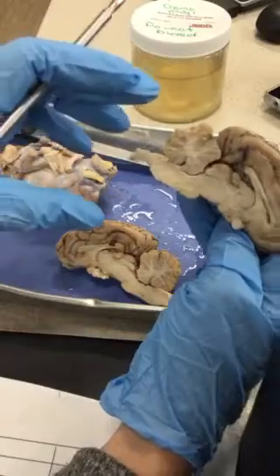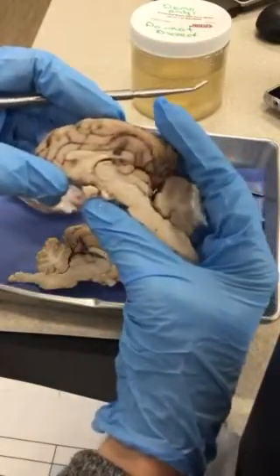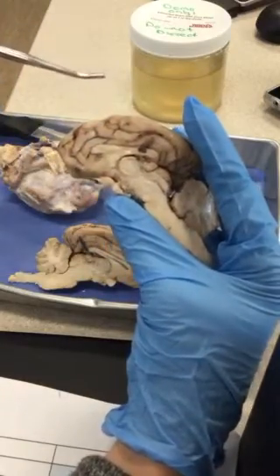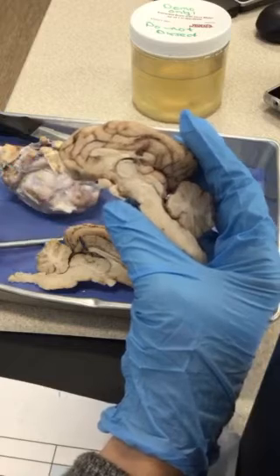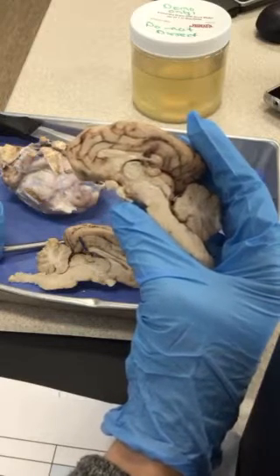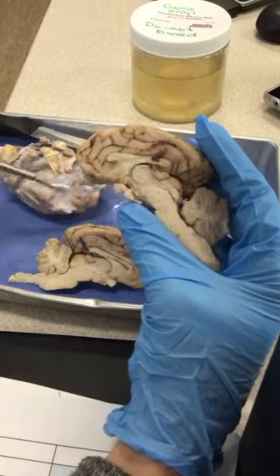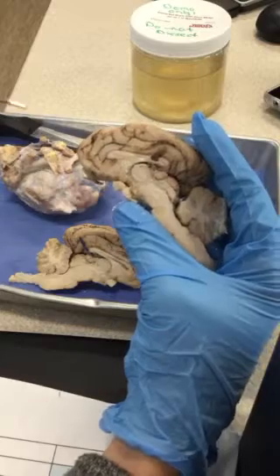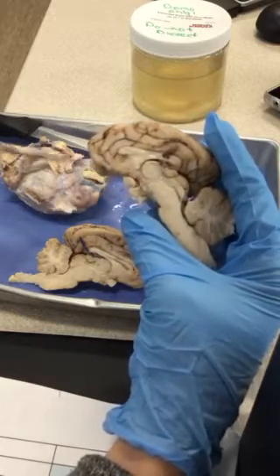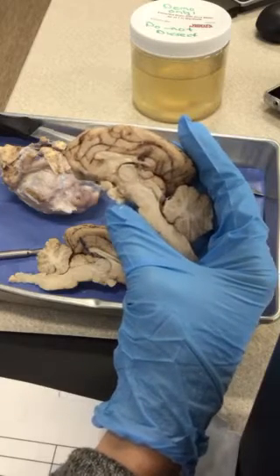Any other hints or suggestions in the sagittal view? When it comes to the lab exam time, the devil's in the detail of the question. If I'm looking for a space, even though that's like a ventricle, like when I look for the cerebral aqueduct, I'll say name this groove or name this canal. Then lateral ventricle, third ventricle, and then the fourth ventricle. I'll always ask for a space, so at least you can narrow it down to one of those three, based on what I'm looking for.